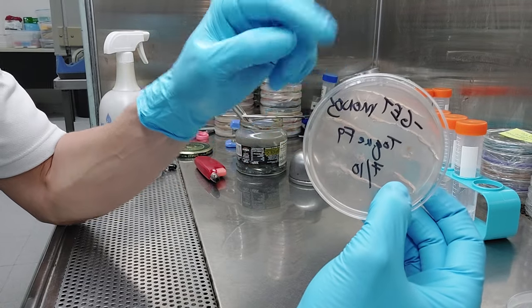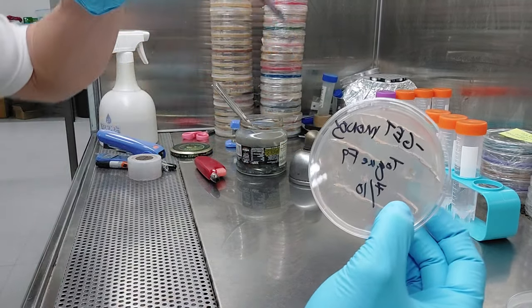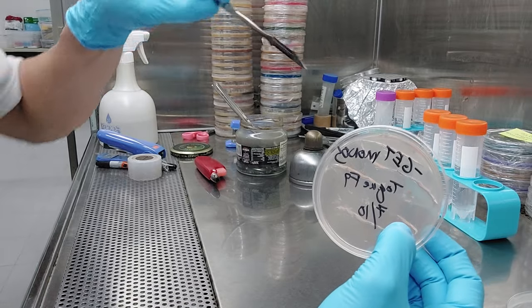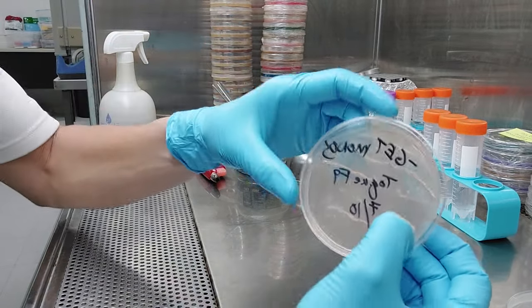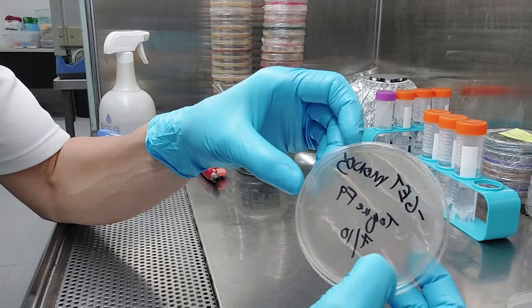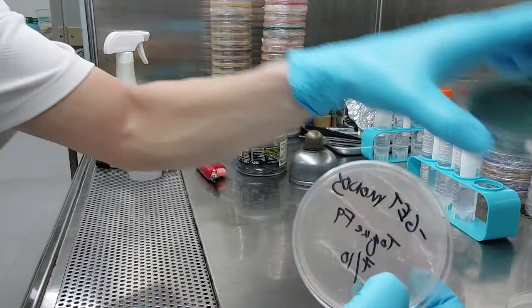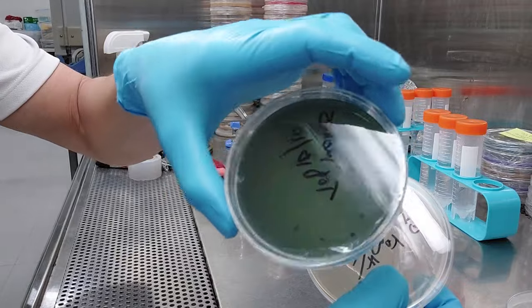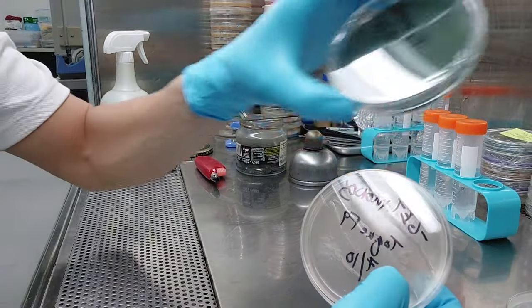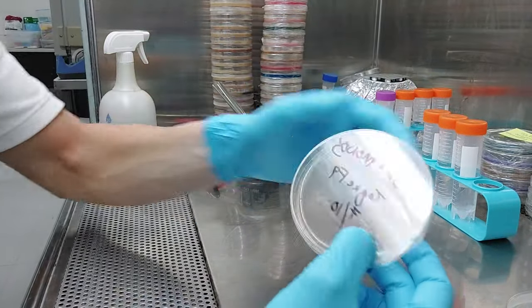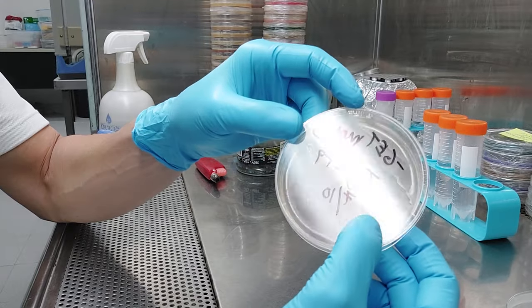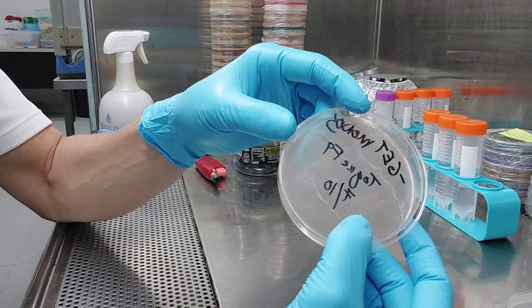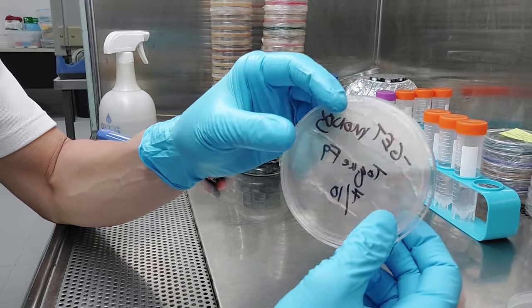Would have been a lot easier to pry those little chunks out of there on that third cut. The other thing is I probably should have made these plates darker. You can see white, kind of translucent mycelium a lot better on a darker plate. I wasn't really thinking the other day. I haven't done this for a few months and I just grabbed the first plate.